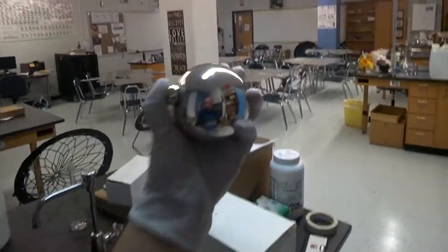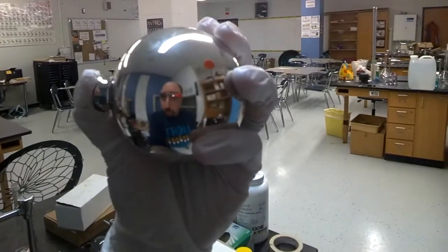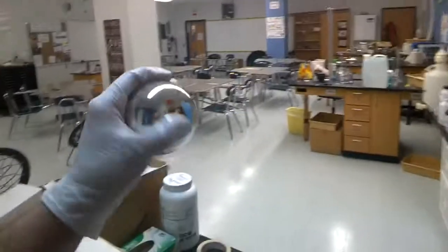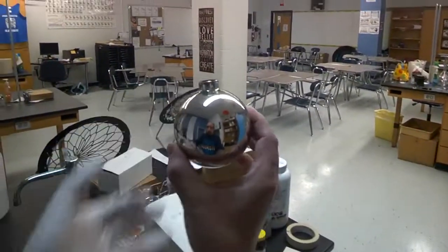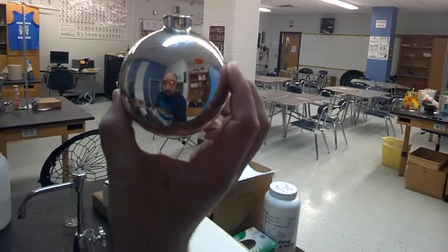And about that point, you are pretty much done. So last, you see that beautiful reflection I've got going on. Yes, that's my beautiful face right in there.